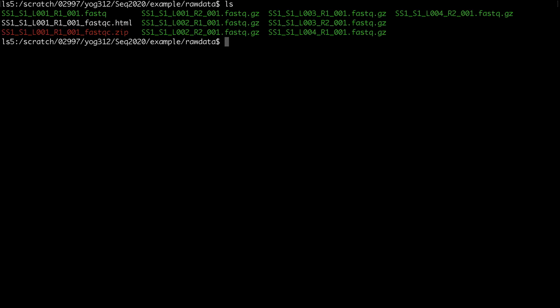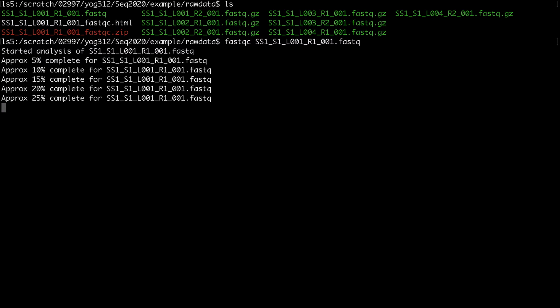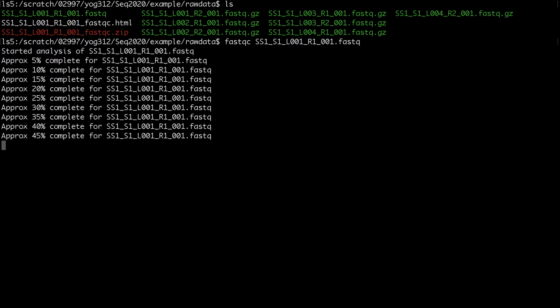So let's see here. If I want to find out the quality of this particular fastq file, what I do is fastqc, and then you just type your fastq file name, and hit enter. And then as you can see here, it started doing the QC analysis on it. Since the size of file is pretty small, it's going very fast.